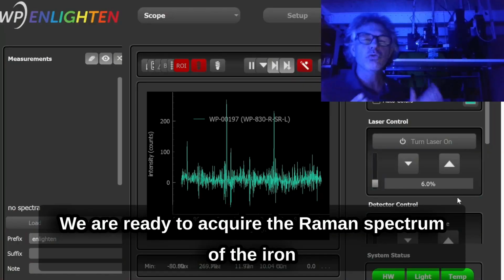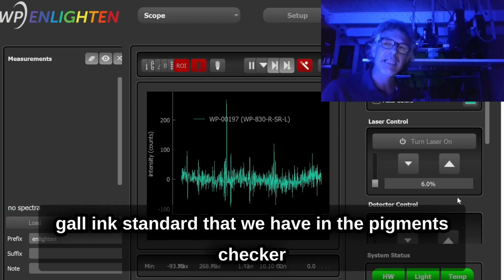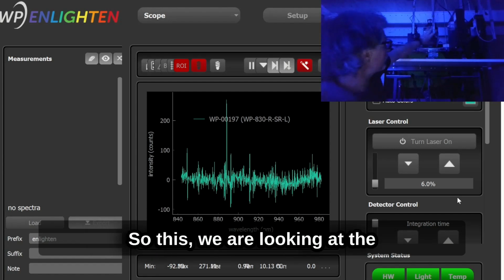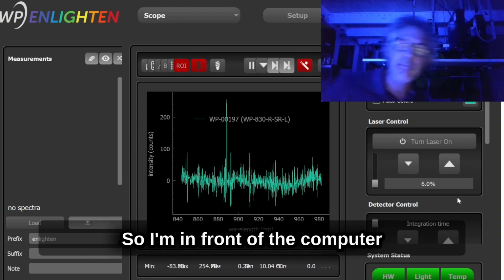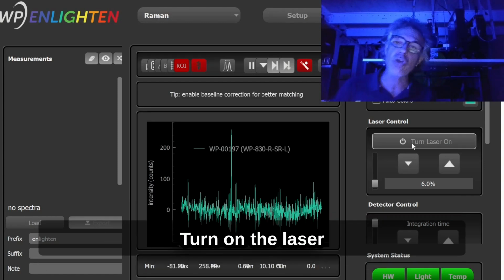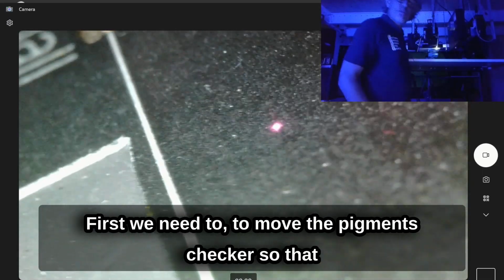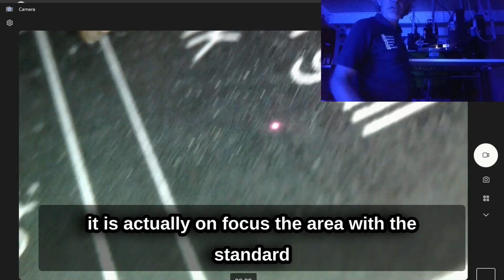We are ready to acquire the Raman spectrum of the iron Gall ink standard that we have in the pigment checker. The pigment checker is over here, and we are looking at the Raman system from the other side. I'm in front of the computer. This is the software to run these spectrometers. Turn on the laser. First, we need to move the pigment checker so that the area with the standard is in focus.